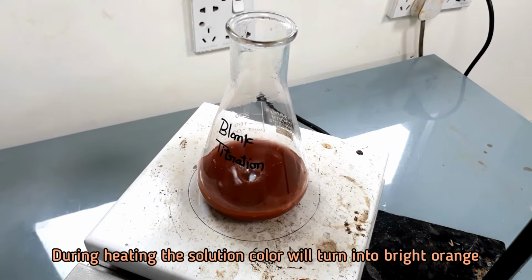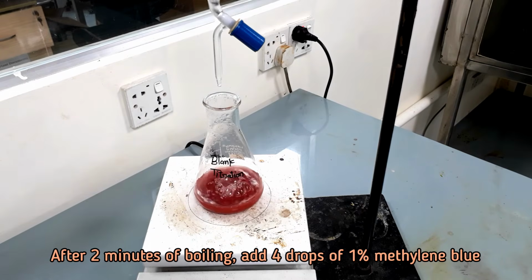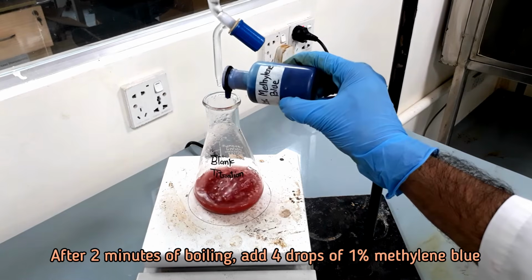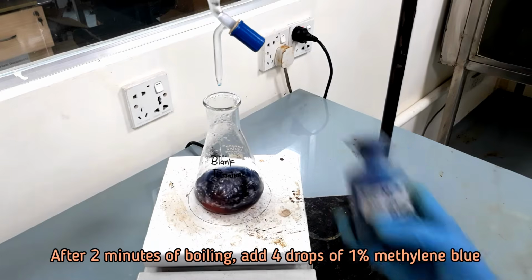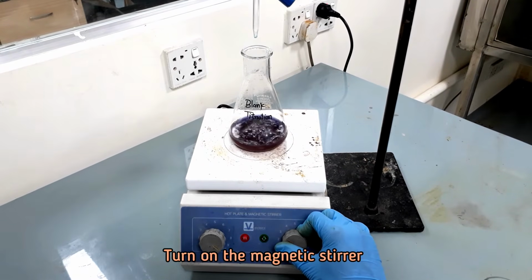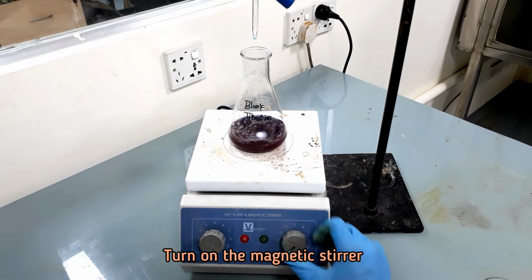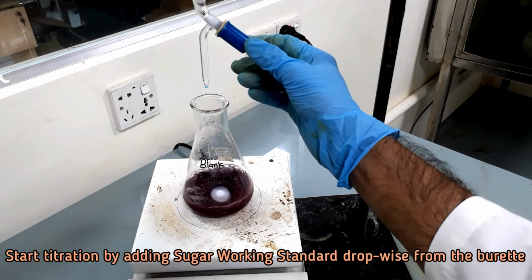Boil the solution for 2 minutes. Now add 4 drops of 1% methylene blue. Turn on the magnetic stirrer. Blank titration should be completed within 3 minutes after the addition of working standard.